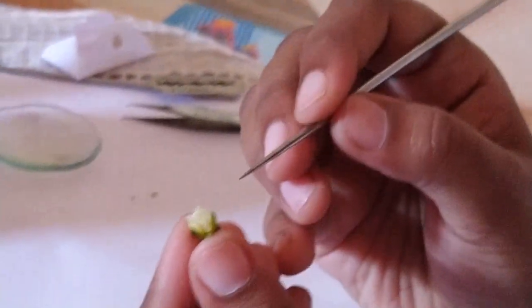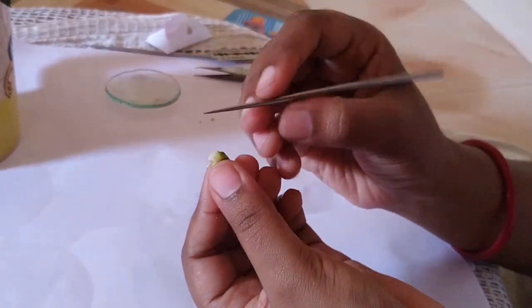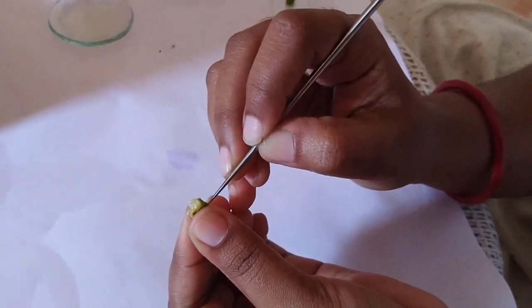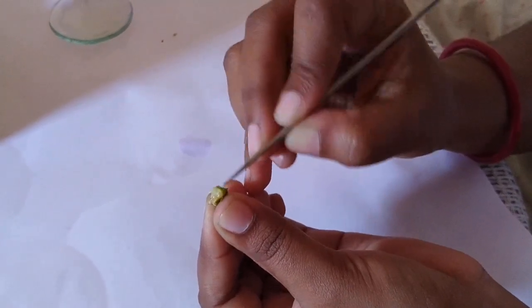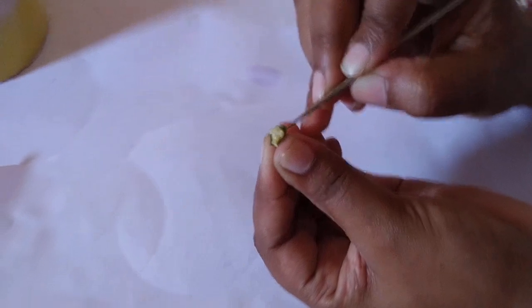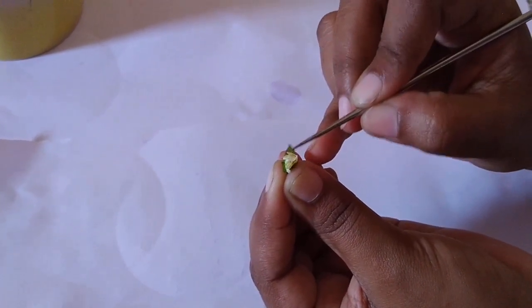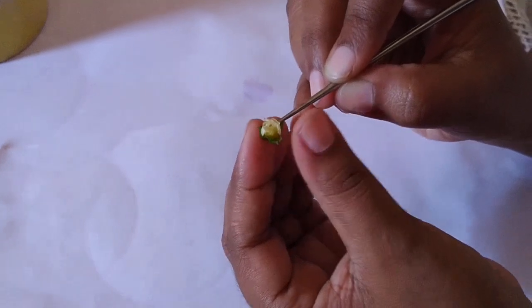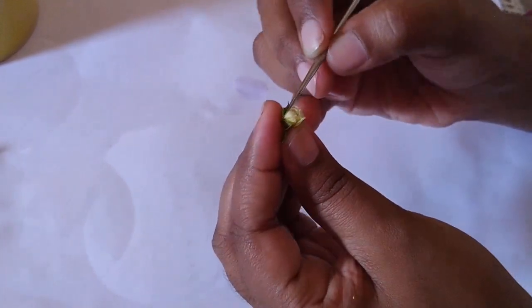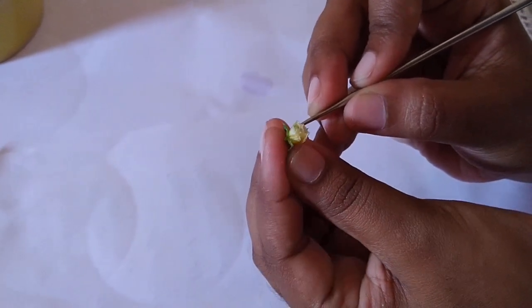Let's dissect the flower of Sida. First of all, you have to give a small incision through its sepals, and separate out the sepals from the flower. Here you can see that the number of sepals are 5 in number.